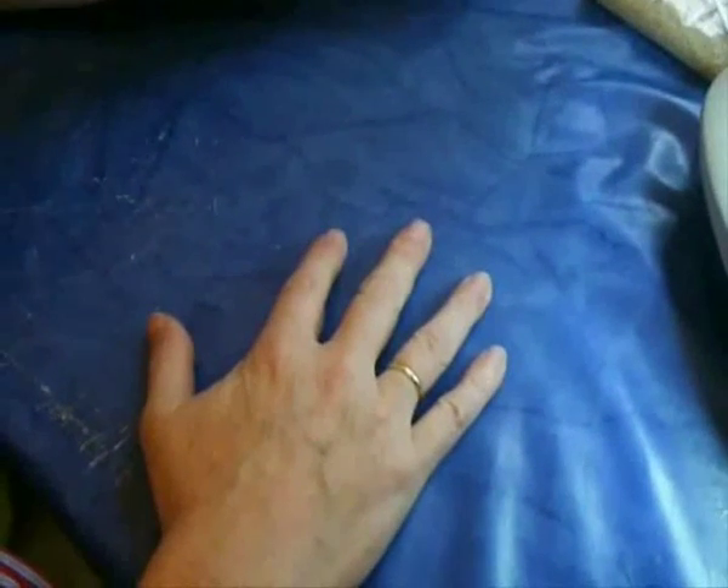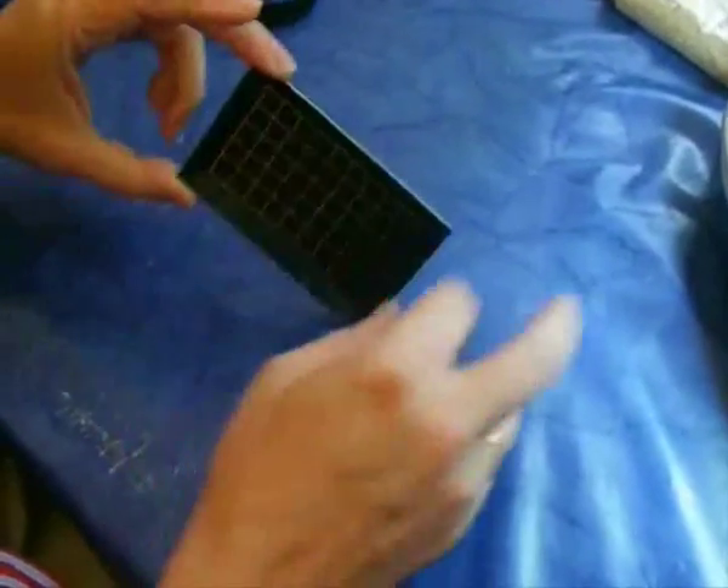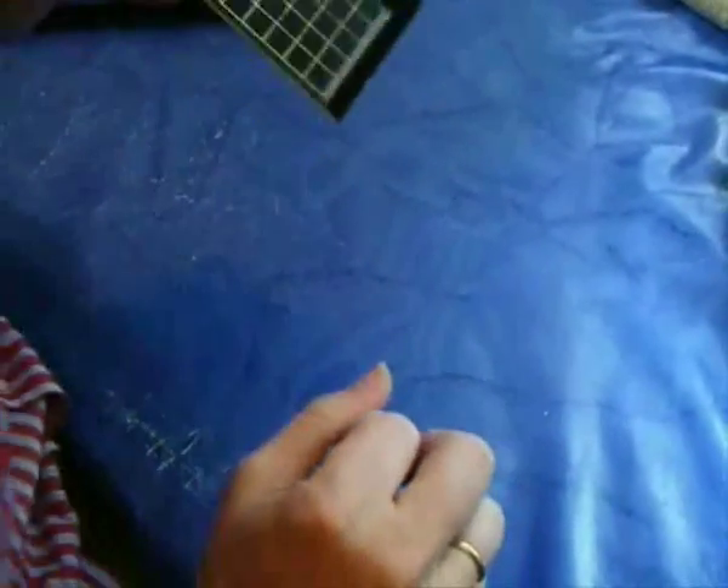We will take a look at a sample from Tunisia from the beach. The first thing we have to do is to clean our tray, because we don't want to mix our new material with old ones which have been in the tray.